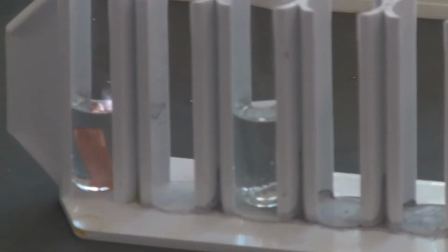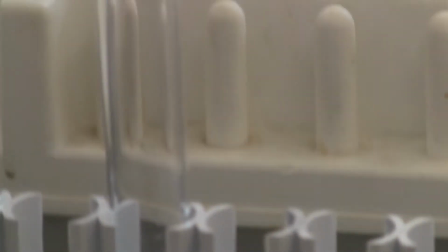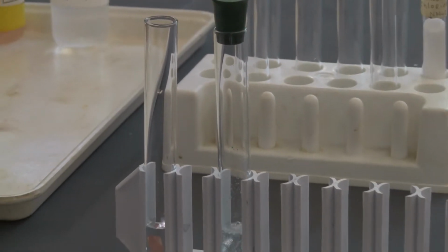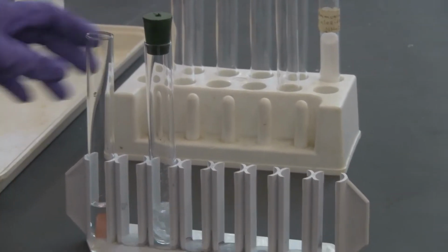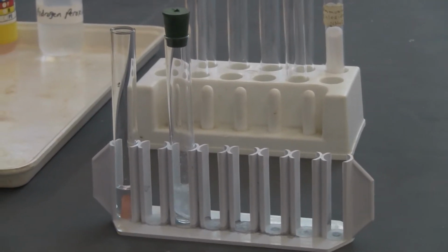You can see the reaction. One has already started, and in the other nothing happened. Then I'm going to put the rubber stopper on to hold the gas that is forming. I may need to do another one, but you can see this one seems to have no bubbles forming, so we can save our energy for that part. We can just quickly test it.